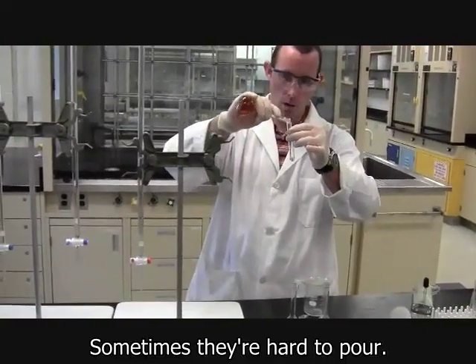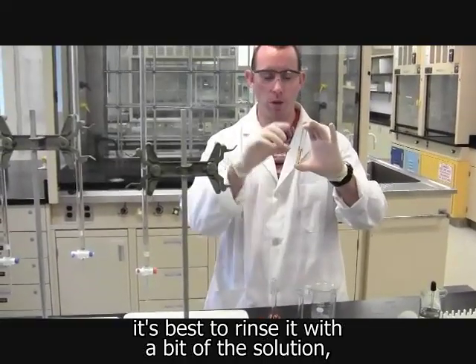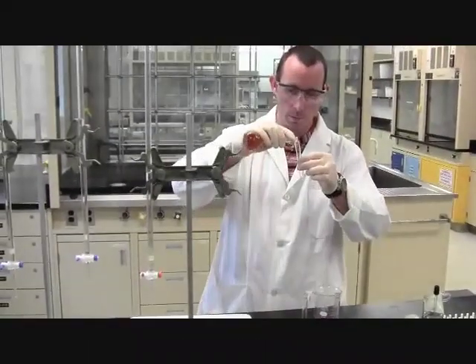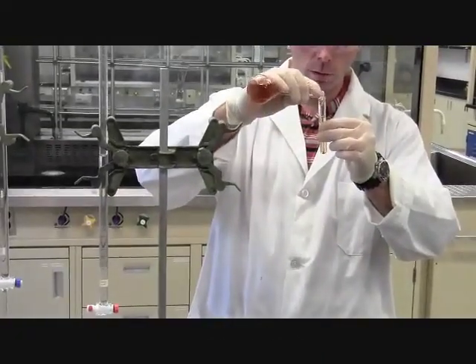Sometimes they're hard to pour. If they're hard to pour, you can pipette it out. I actually want to rinse this out first because I didn't know what was in here beforehand. It's best to rinse it with a bit of the solution. So I've got lots of it. Take a little bit, rinse it out, put it in my waste beaker, and I'm going to fill it up about 3/4 of the way with my sample.